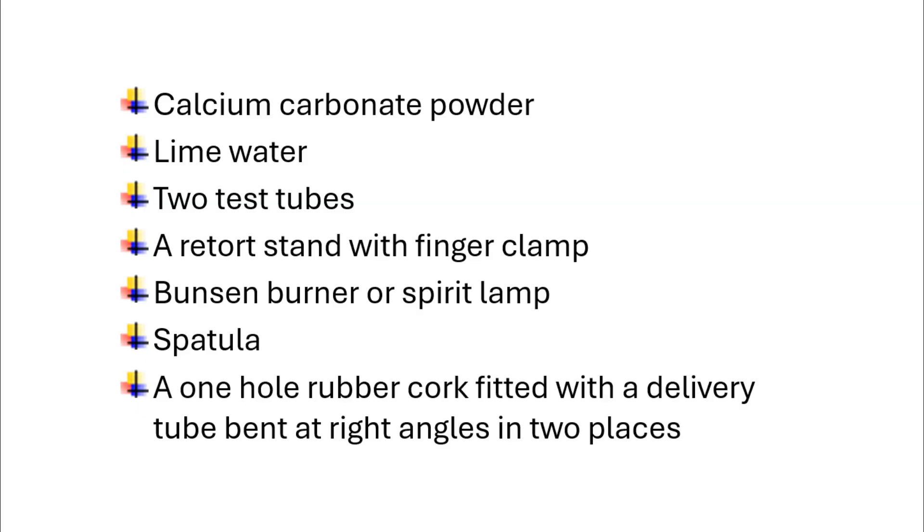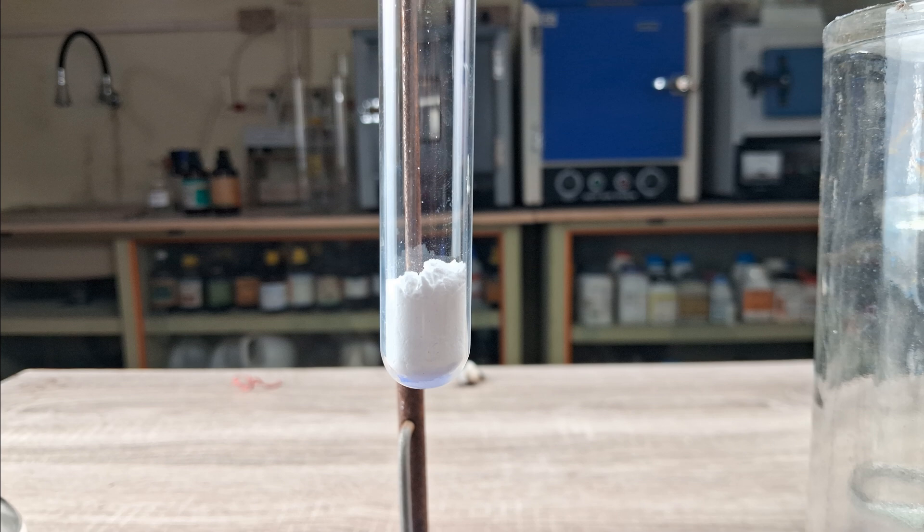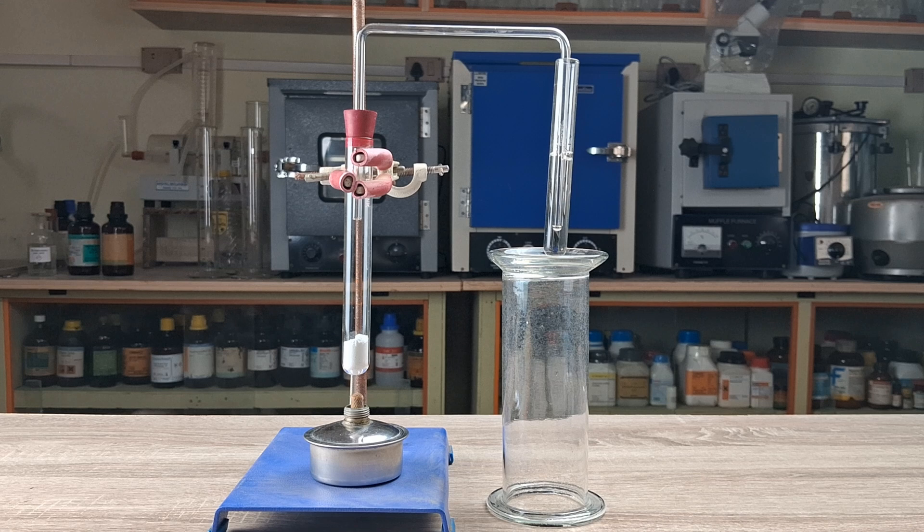To perform this experiment, take a spatula full of calcium carbonate and introduce it into one of the test tubes. Arrange the materials to form an apparatus as shown here. Lime water is taken in the second test tube and the free end of the delivery tube is introduced well inside the lime water as shown.